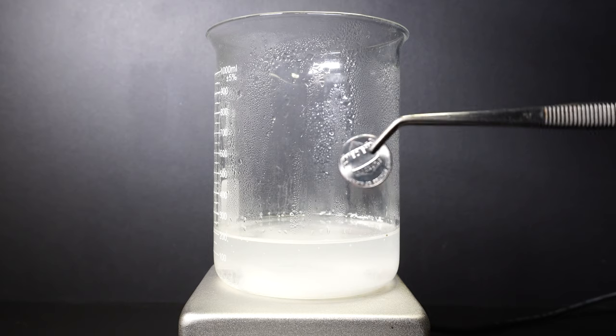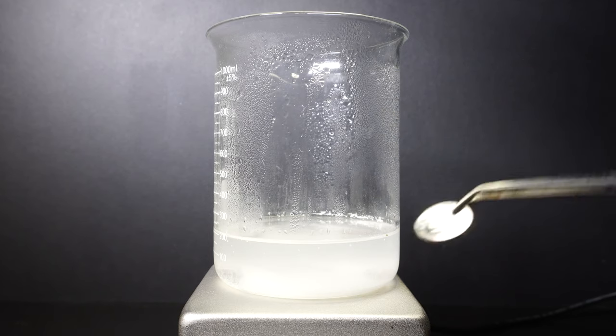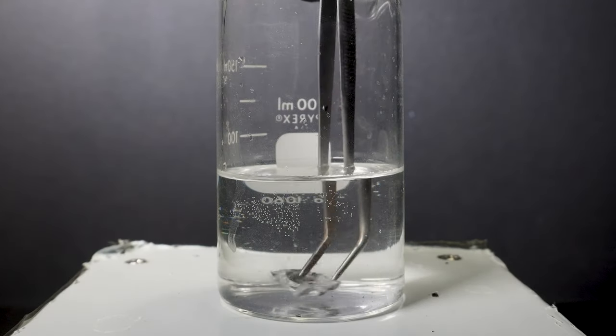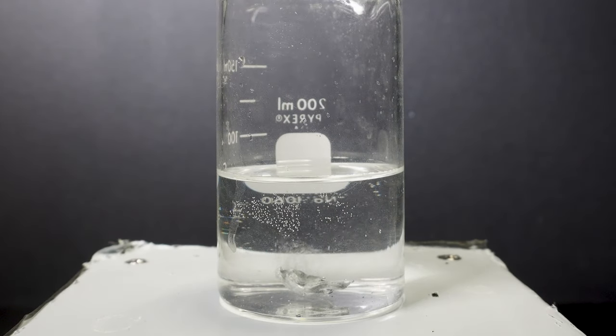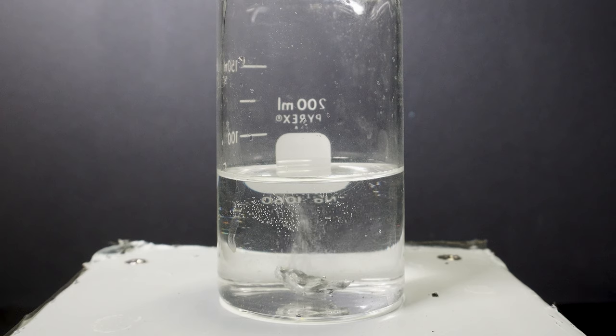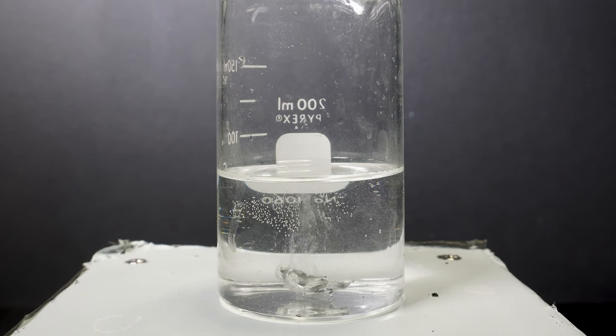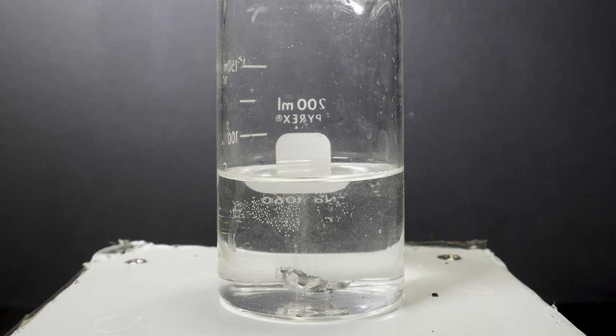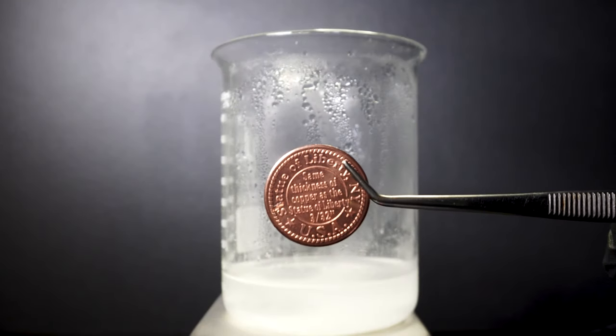This is a great sign however to do my pure copper coin I will need to get more zinc pieces in the solution. I decided to clean some zinc of oxidation layer by adding it into acetic acid followed by a water bath. This cleans up all the zinc and it can be used in this project. Once I add my now clean zinc I am ready to continue.